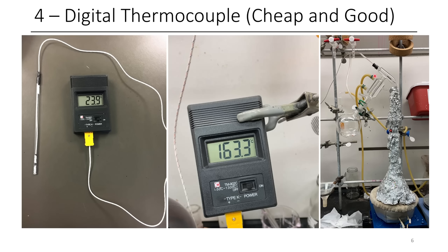And I was able to do this very easily. Now, the one consideration is if you're going to use some sort of distillation apparatus, you just need to make sure that you have a cork which can form a seal around your NMR tube or whatever you're going to put to enclose your probe.